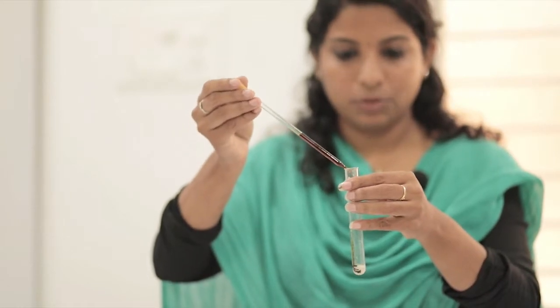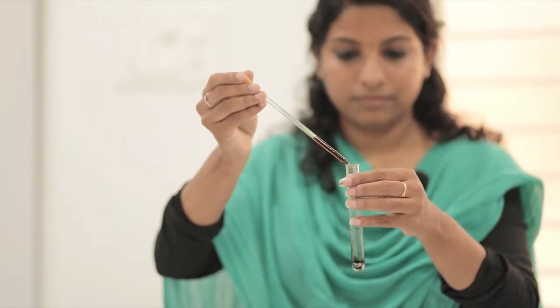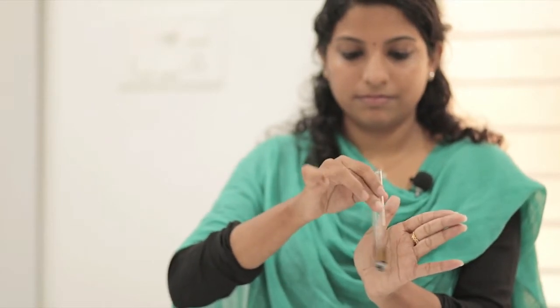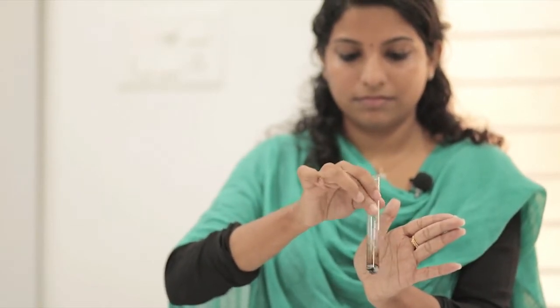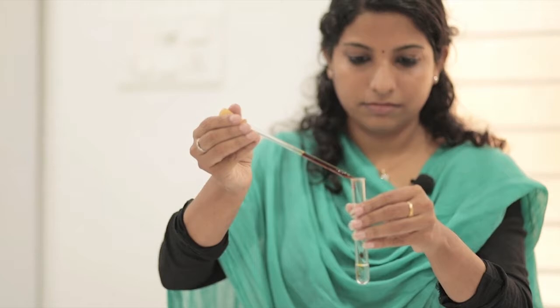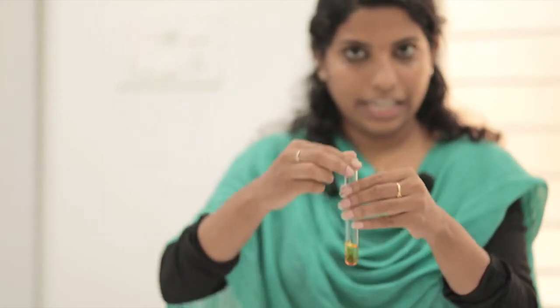To the rice solution, I am going to add three to five drops of iodine solution. Then we have to mix it. Next, to the water solution, I am going to add two to three drops of iodine solution. Again, mix it.